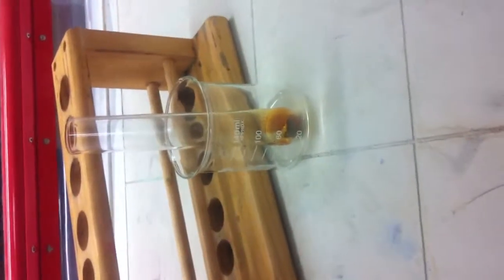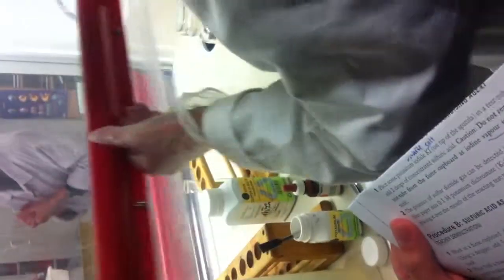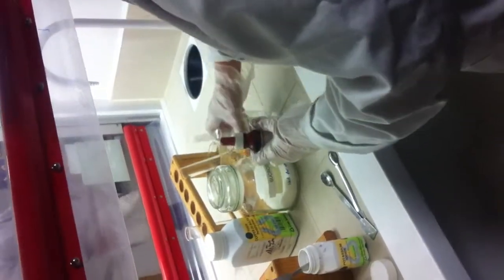Do we want to prep that? Place potassium dichromate solution. So that's that orange, yeah? We could do that. You did read the whole thing? Oh, you said the first step. I might have to do the second step.